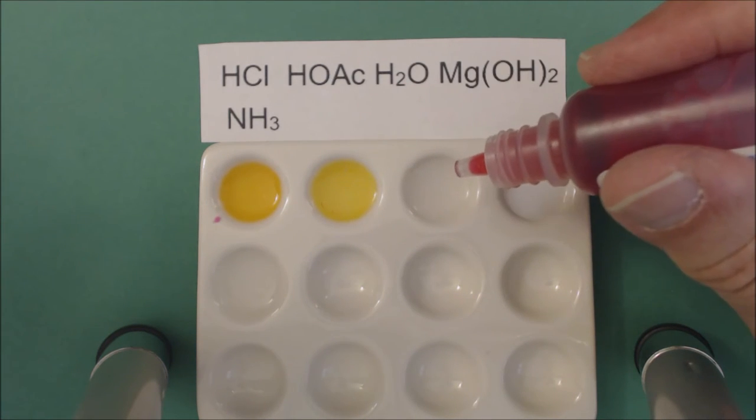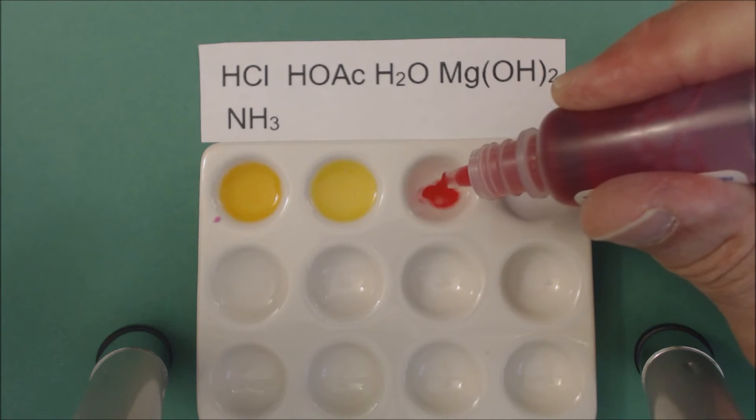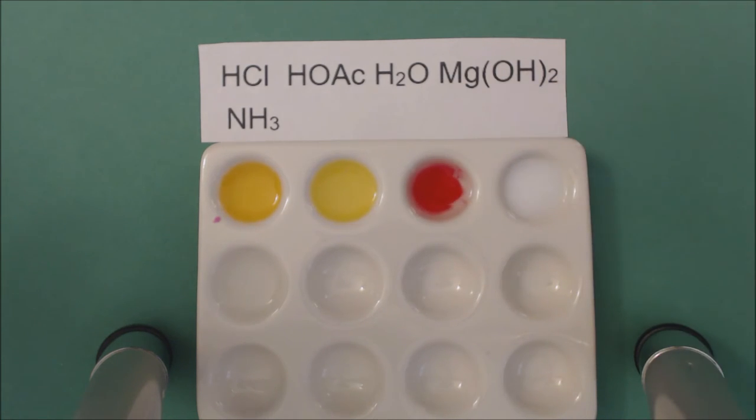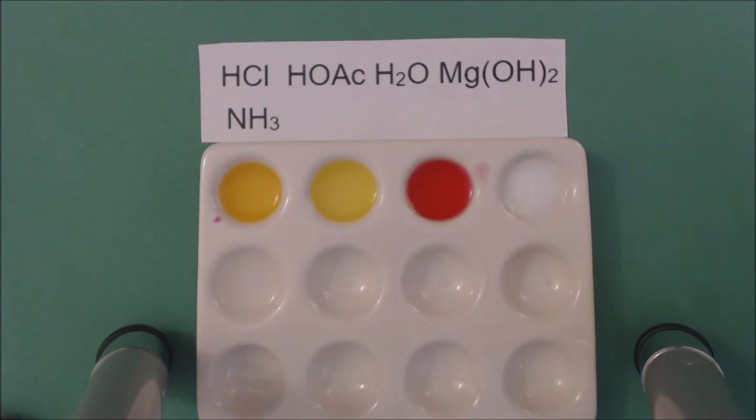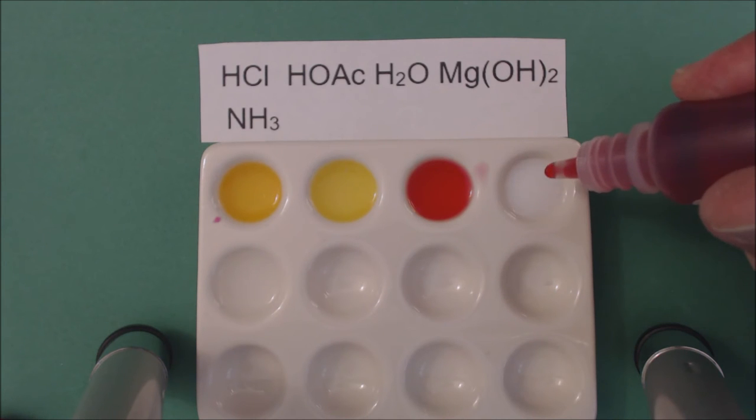It's also yellow. Tap water—let me mix this up a little better—it's kind of pinkish, so it might be just a little on the high end.